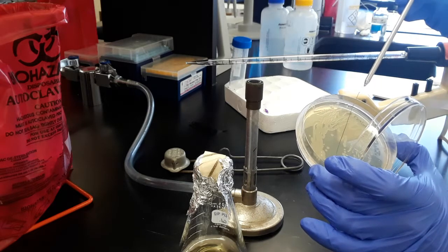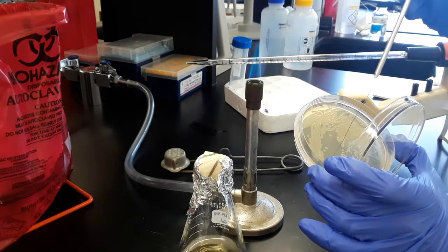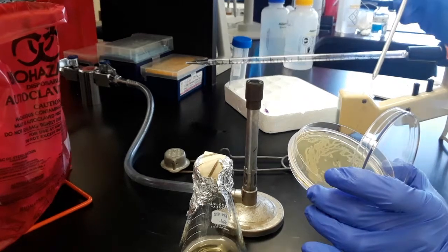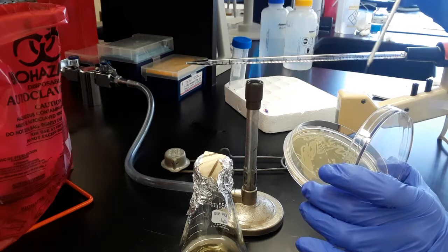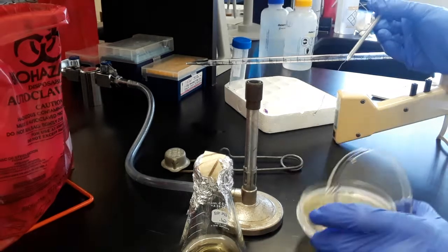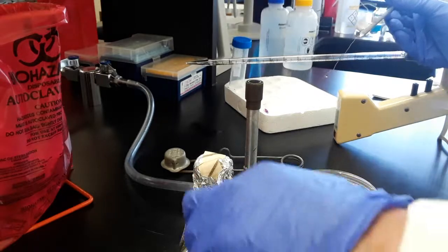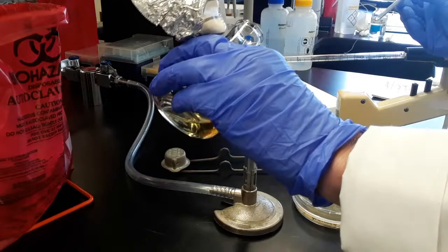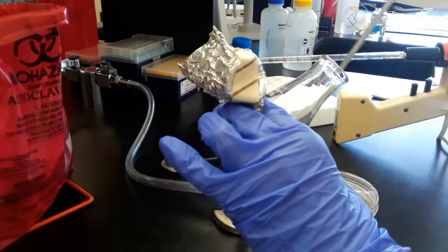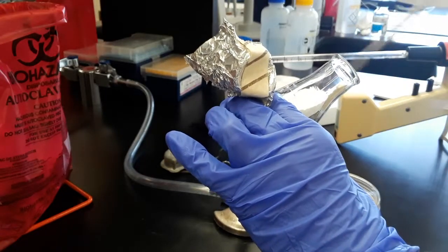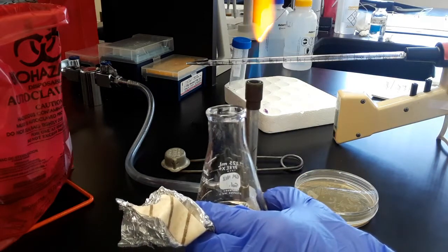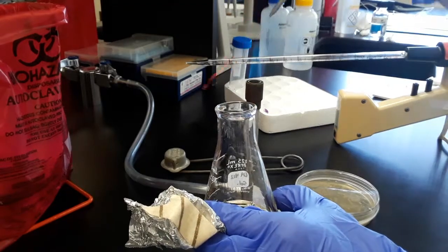You can't see me, but I'm talking away from the flame area so I don't breathe in this direction. I'm just going to get some of the bacteria on this loop. Inoculate the liquid. Going in with the loop again.